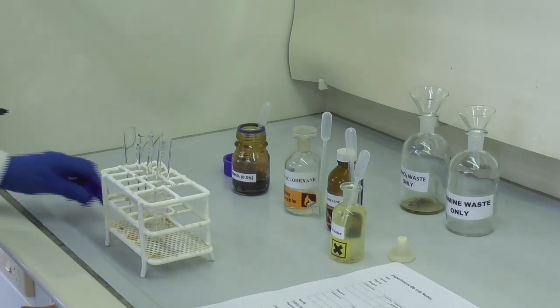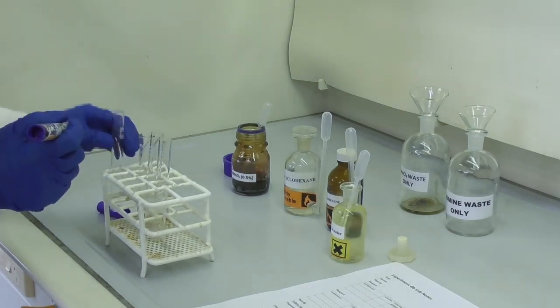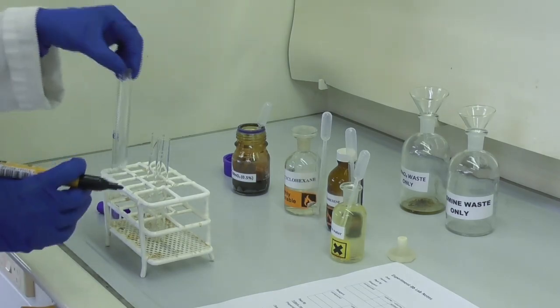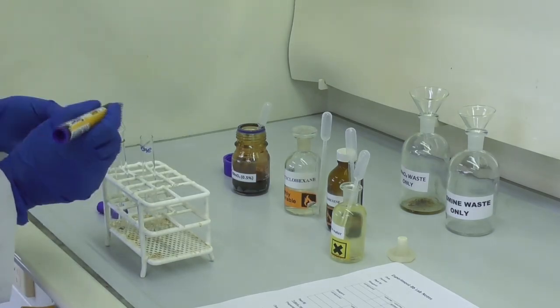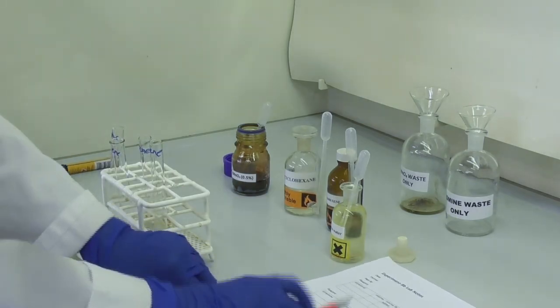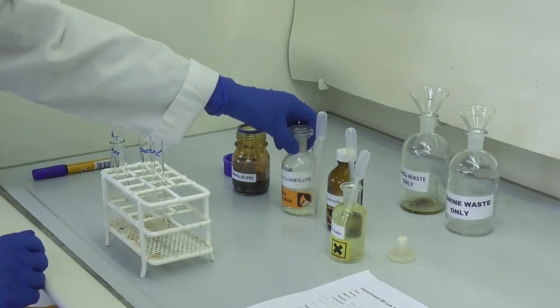All the reactants for this experiment are set out in the fume hood. We start by labeling four test tubes appropriately: two with alkane and two with alkene. We also make sure that we have our notes at hand and take notes while we are doing the experiment.